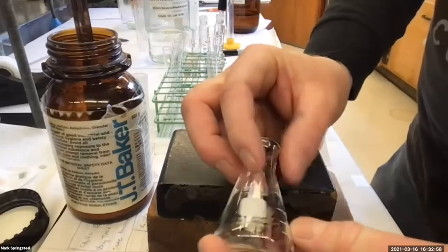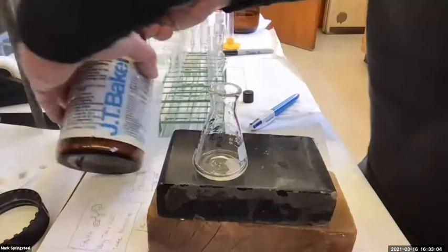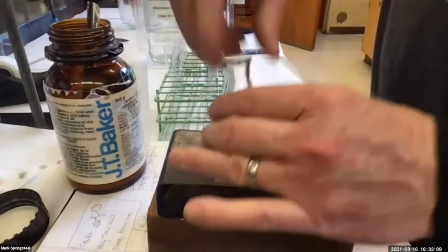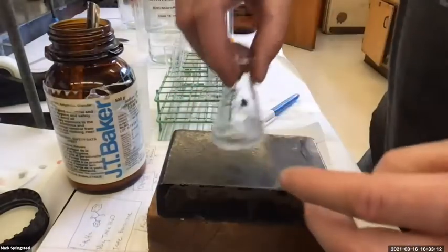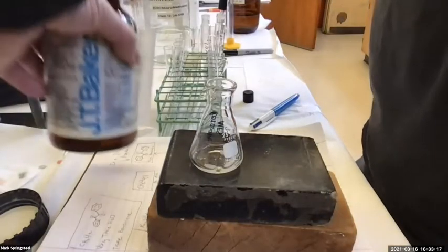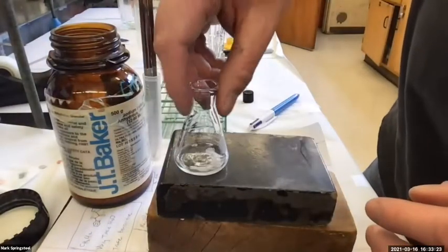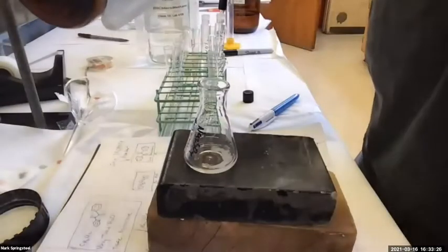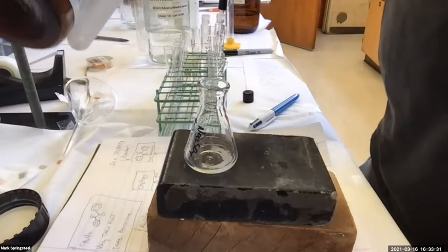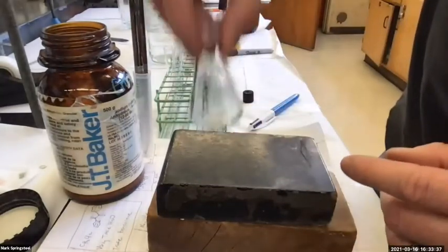And the little beads of water that were stuck to the inside of the glass, I don't see them so much. But I don't see any little fine grains yet, so I'm going to do more. I'm still just seeing clumps. So I'm probably gonna have to add a little more sodium sulfate because I didn't do the brine pre-dry, huh? Yeah, that's nice. Yeah, it's working out as expected. I'm having to add a little more sodium sulfate. I'm probably gonna add like twice as much sodium sulfate as I had to on the last drying because the last one had a brine pre-dry.